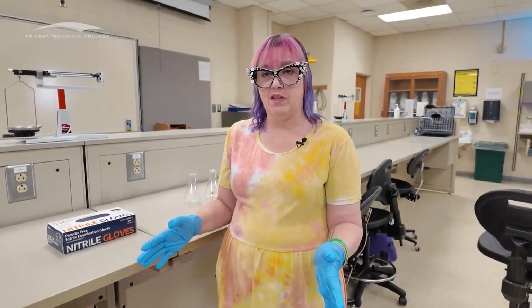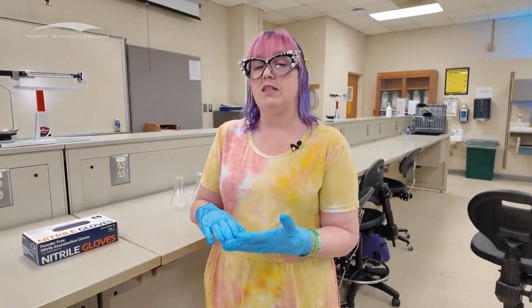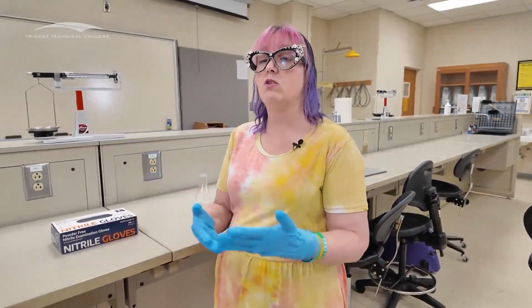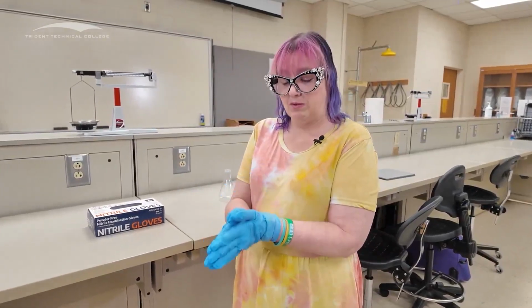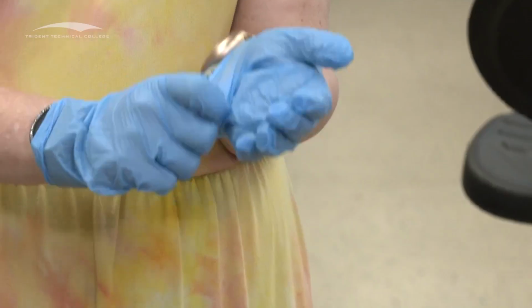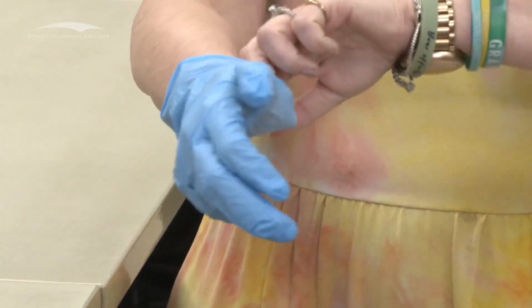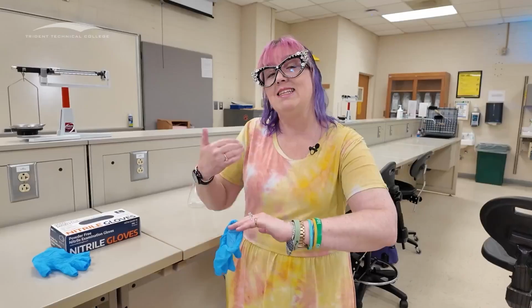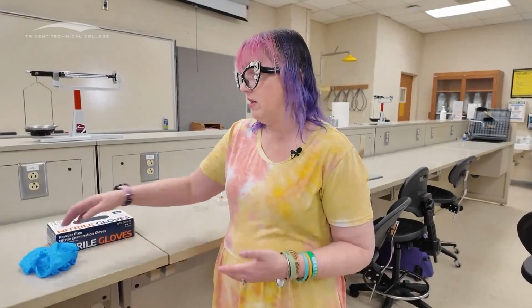When I'm in the lab and I'm working with these gloves, everything is fine. If I have to leave the lab for whatever reason, I need to go to the bathroom, I need to take a phone call, I need to eat something, I need to do something outside of the lab, including taking a drink, then I need to take these gloves off. So if I'm going to take these gloves off, I can take the first one off fairly easily, right? Fairly simple. But when I go to take the second one off, I want to hook my fingers inside of it, grab a hold of the inside, and then pull it off like that so that I'm holding the inside when I'm dealing with it, not the contaminated outside part of the glove. And then I take those off.